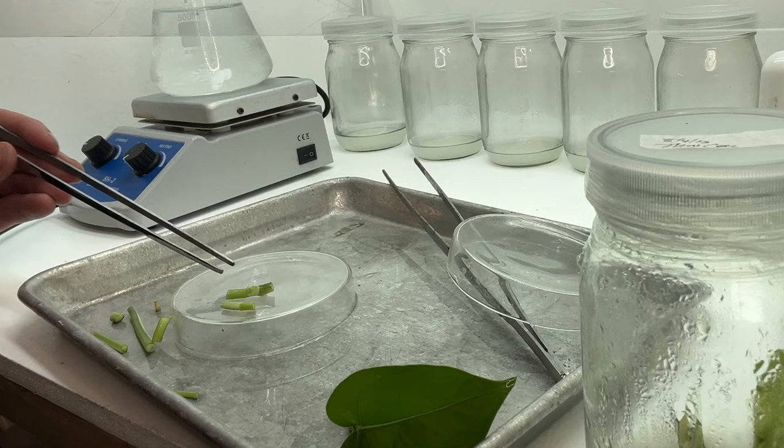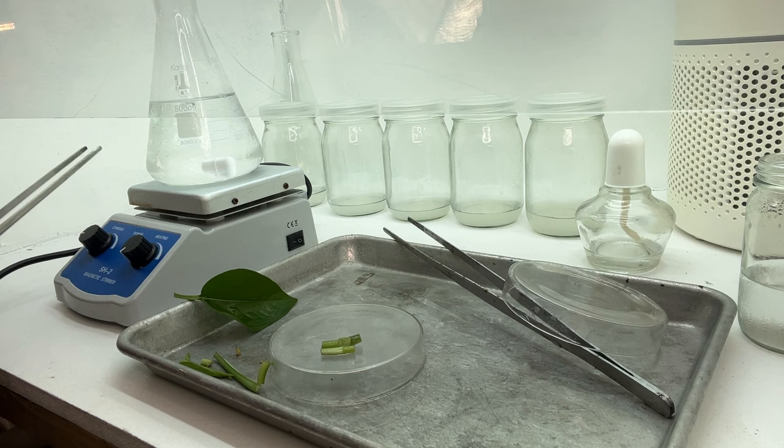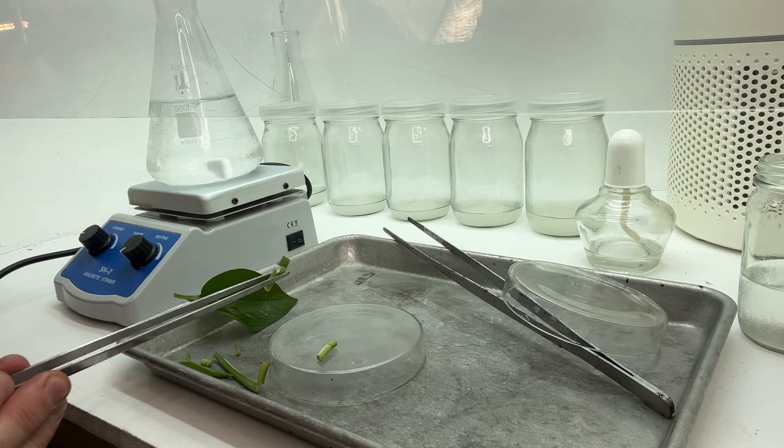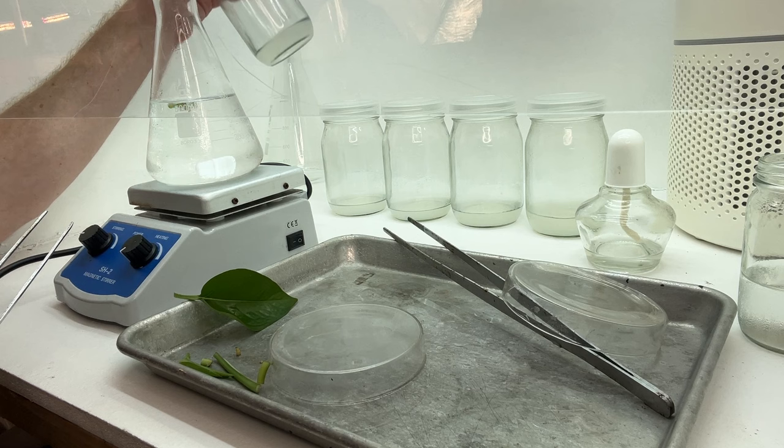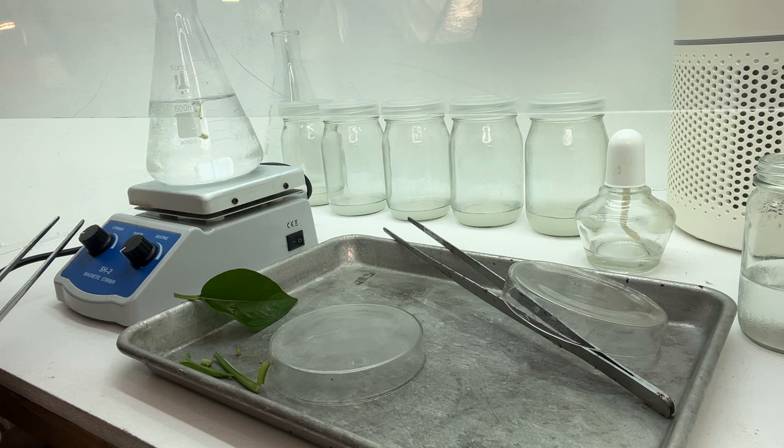Now these are the only two things we need. These are the parts of the stem which contain stem cells. Into our stirrer with bleach, we're going to add these two plantlets. These will now sterilize, because they've come from the greenhouse environment and might have pathogens on them. Before we introduce them to a sterile multiplication media, we want to sterilize them first. We'll leave these in here for about five to ten minutes and come back to put them into the multiplication media.